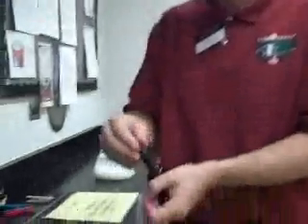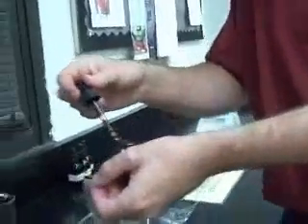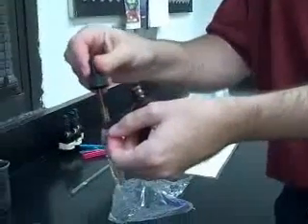I want you to remember that starch is a polysaccharide, right? So it's a very large compound. Poly means many, because it has many sugar rings attached to each other. So we can predict pretty easily that starch is going to be too big to fit through the pores. Probably. So we'll see if the iodine is small enough to enter.